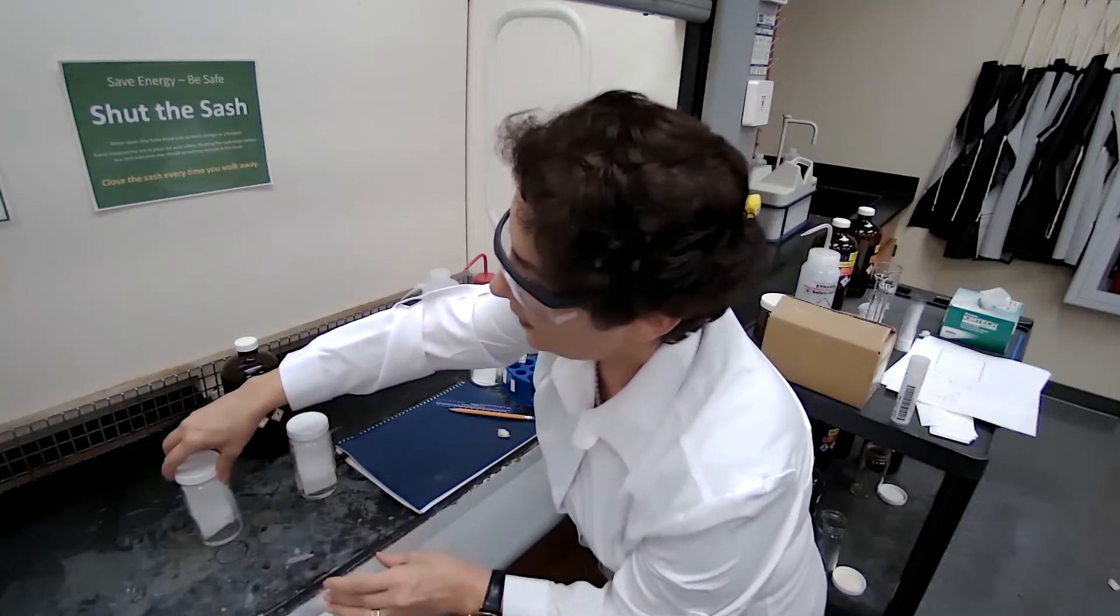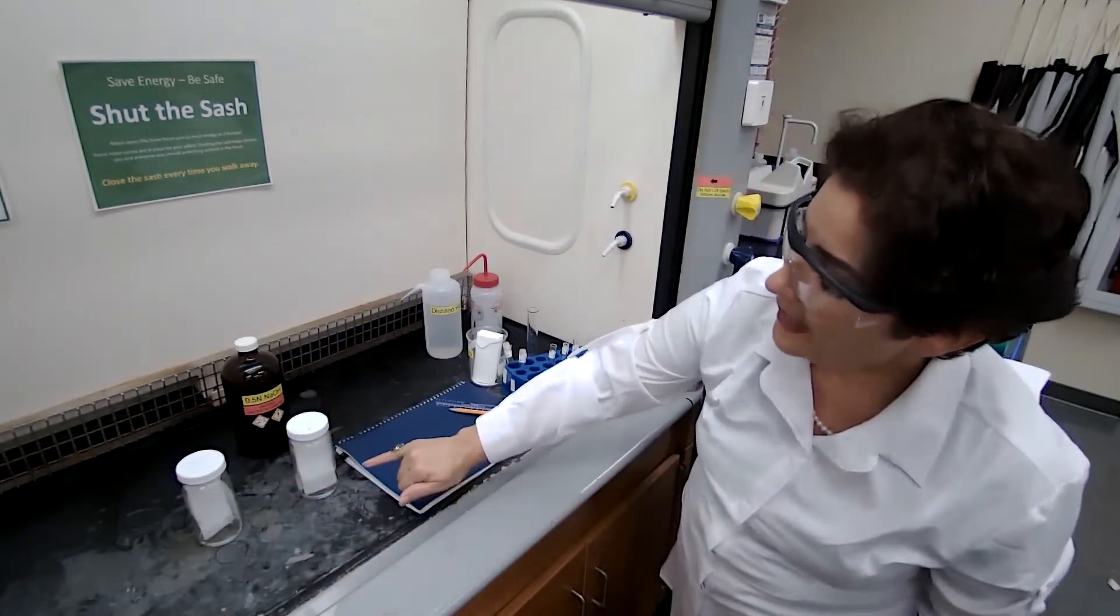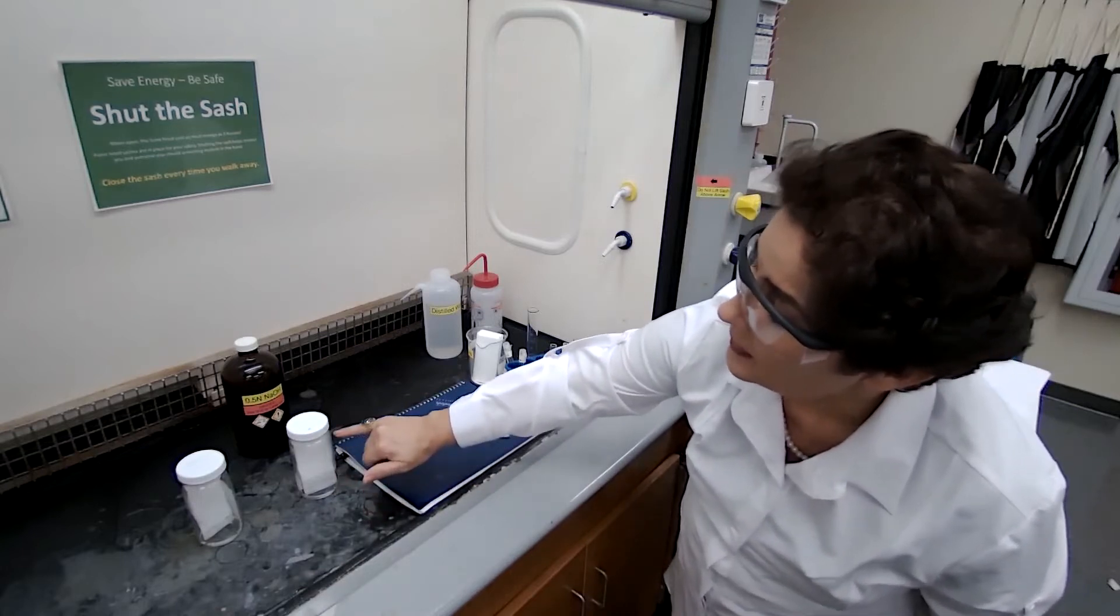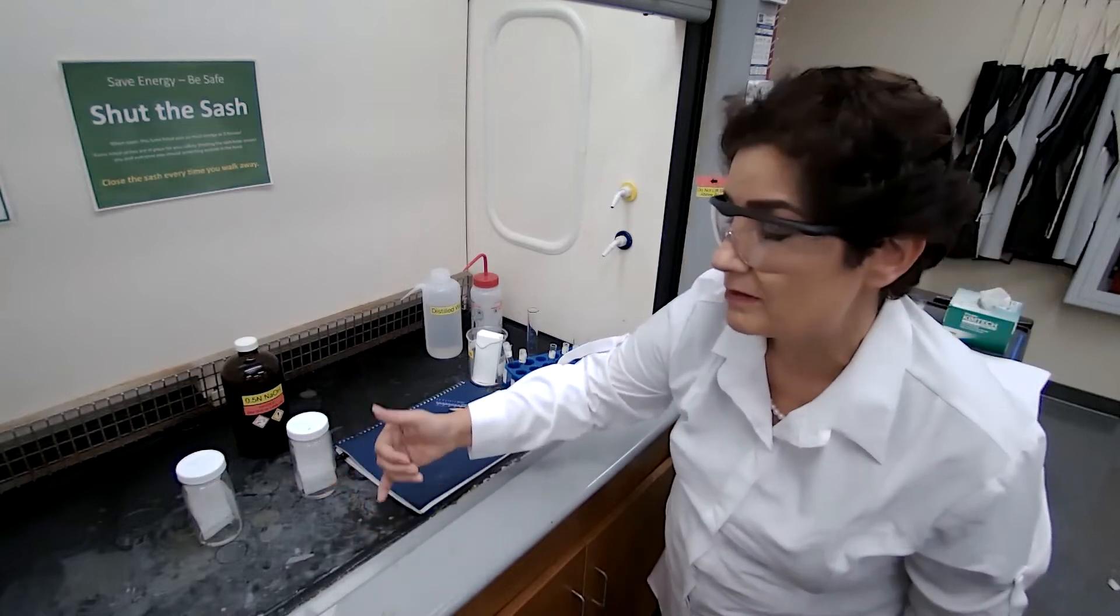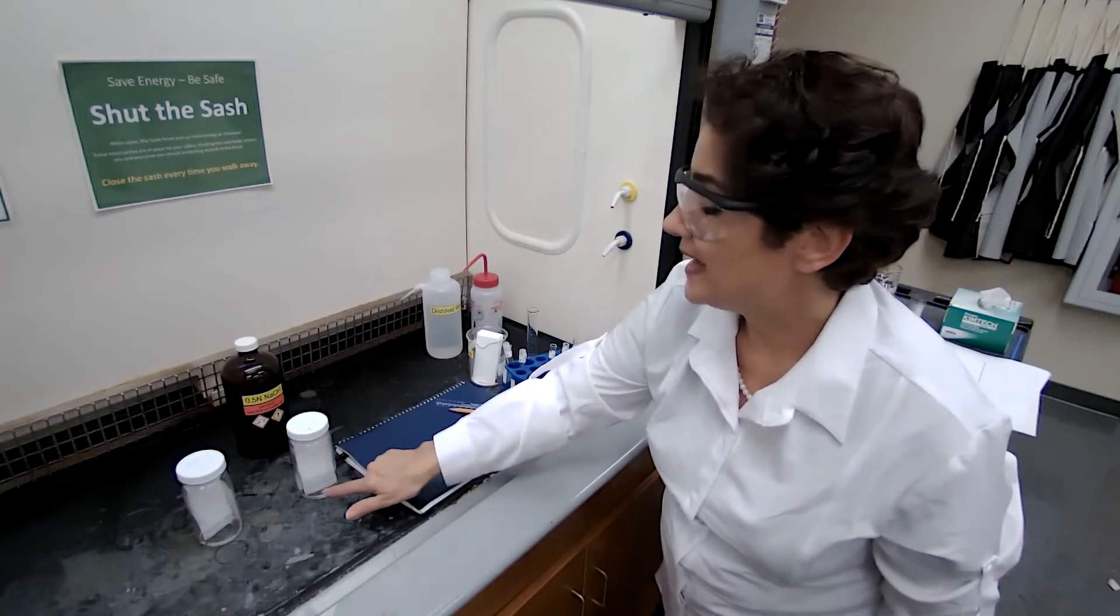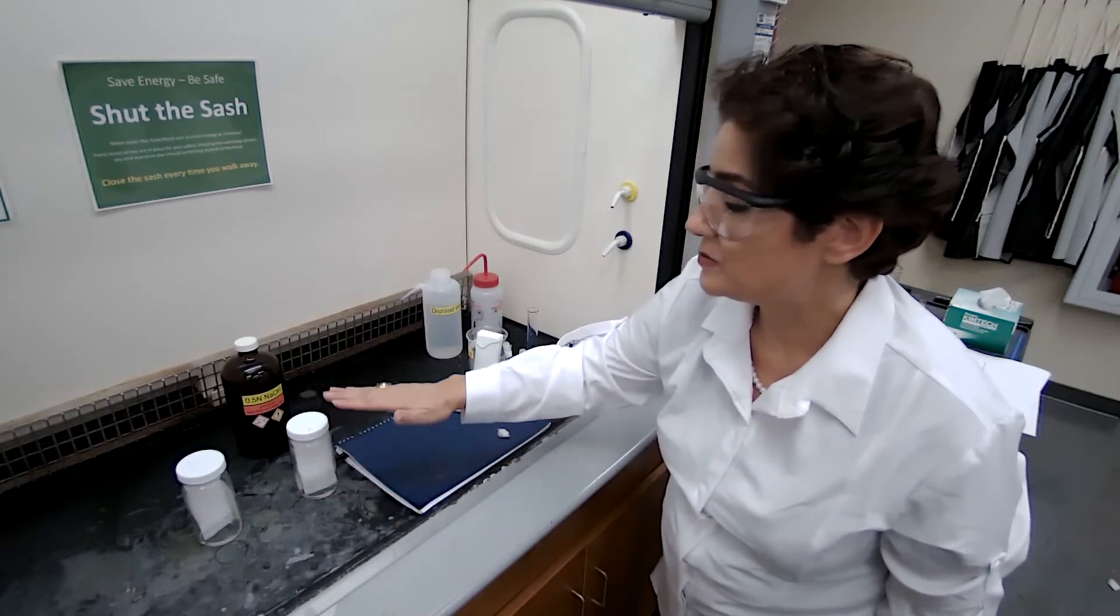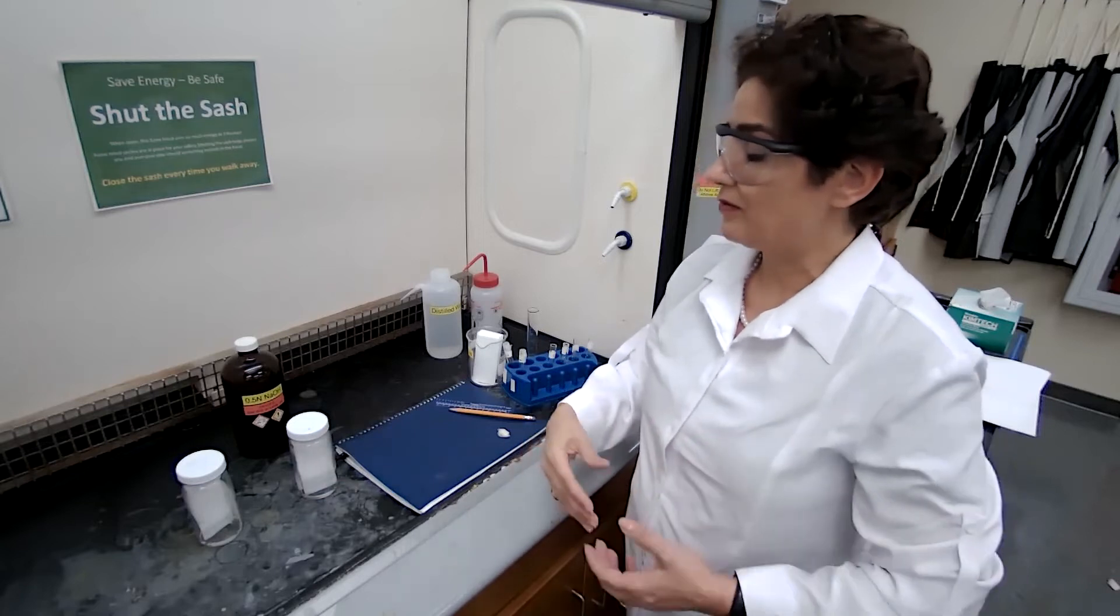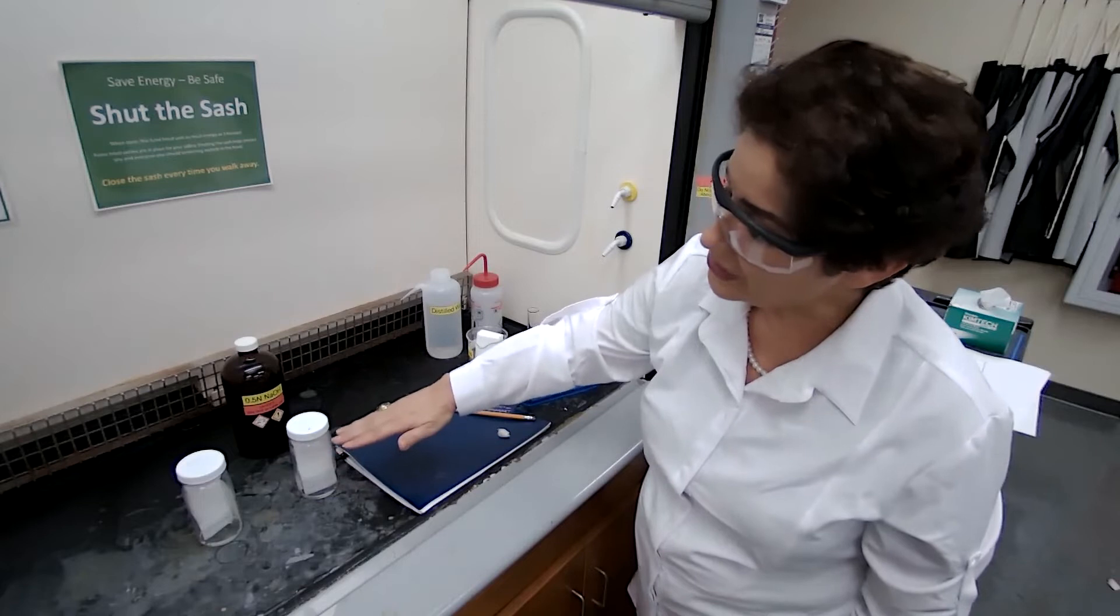Don't want to disturb it, going to stay and wait. And if you could see now, the liquid is moving up. And as the liquid reaches, the liquid meaning the mobile phase in chromatography, as it reaches the sample, it's going to move the sample up as well. Well, for the purpose of the video to be short, I will pause the video at this point and get back to you when it reaches about one inch from the top of the plate.